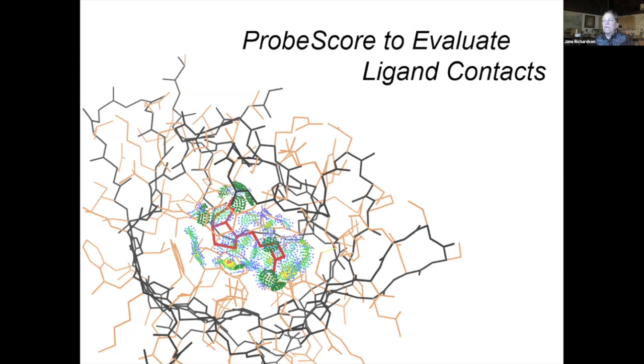We've always had a probe score in MolProbity, but hadn't used it very much, except in doing our own amide and histidine flips. But it's a way of taking, for instance, a single ligand, as here, and doing all-atom contact dots between it and everything else. So you're seeing, for instance, a rough measure of how tight and good the binding of that ligand is. If there were no good contacts, it wouldn't bind there. And so if you model it and it doesn't have good contacts, either a lot of clashes or very little other contacts, then you've got the model of the ligand wrong.